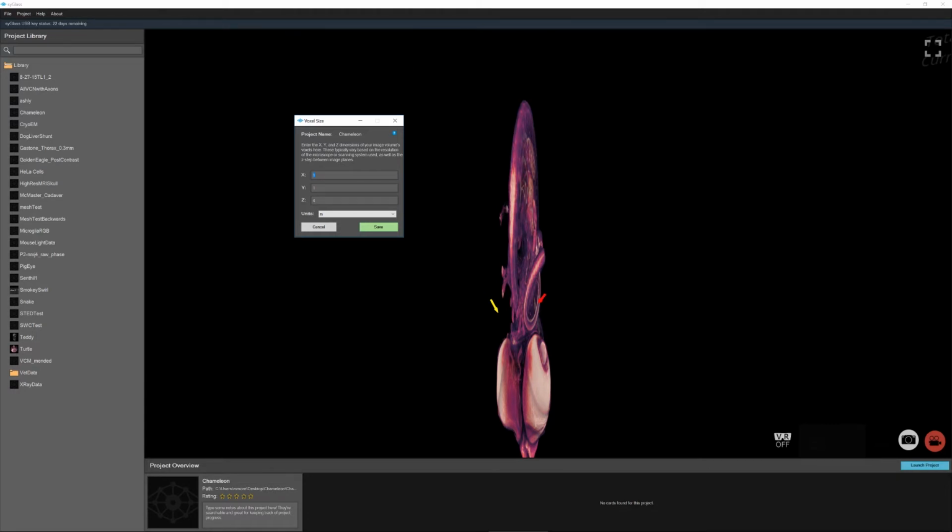So let's say that this scan had a voxel dimension of let's say 1 millimeter per side. So we're going to change one here, we're going to put one here, and we're going to change this to 1. And we're going to come down here and just change this to millimeters, and we're going to hit save.